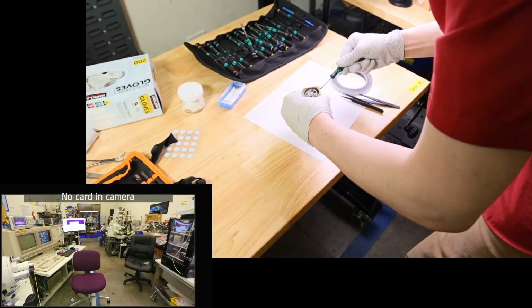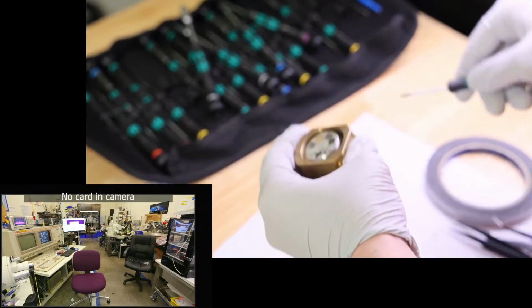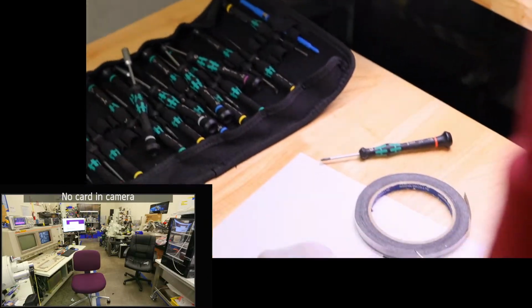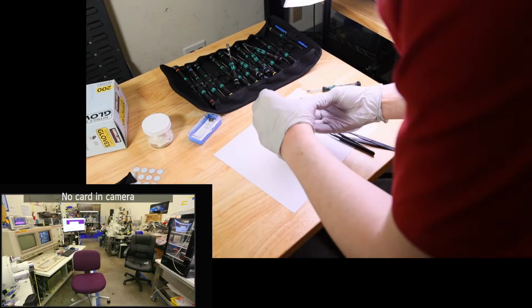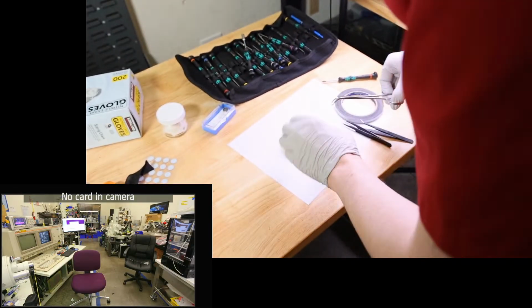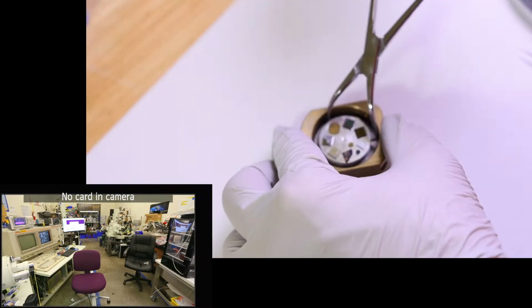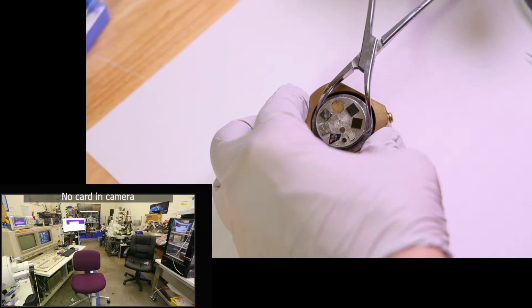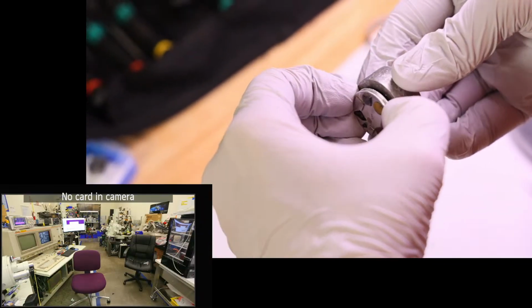So we'll get our Phillips out and loosen that. Okay, that's a bigger Phillips than I got in this kit, but I might have lined something up correctly. Did not. Okay, we'll use the pliers to do this. There we go. So that's released the inner part of that. Oh, this one, it just fit in there like that. That's kind of funny. Oh, it's really in there. Okay.